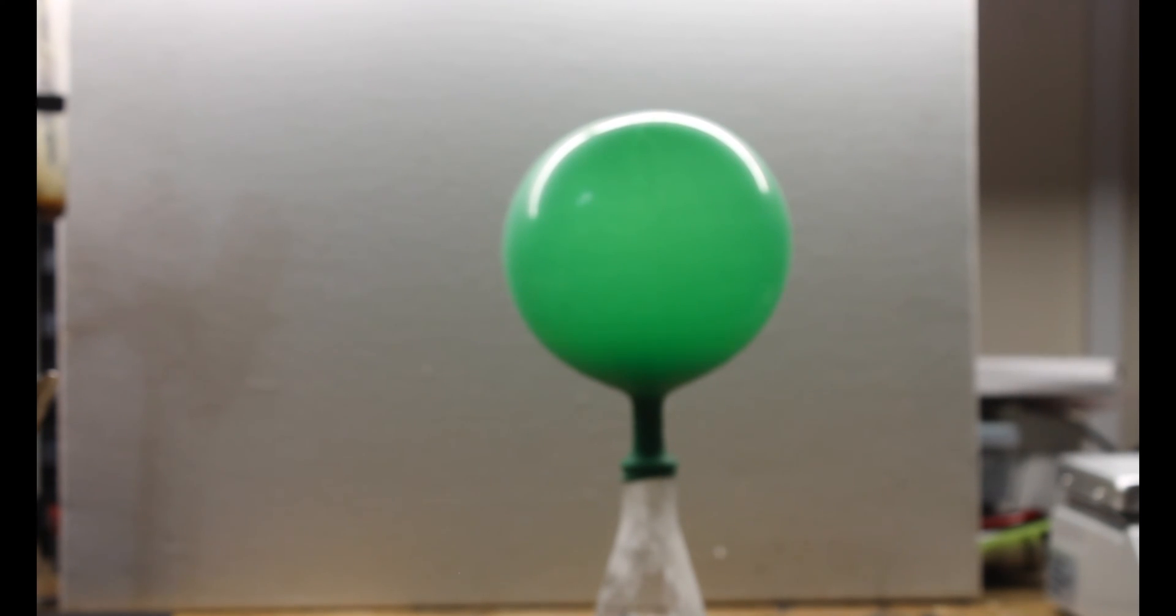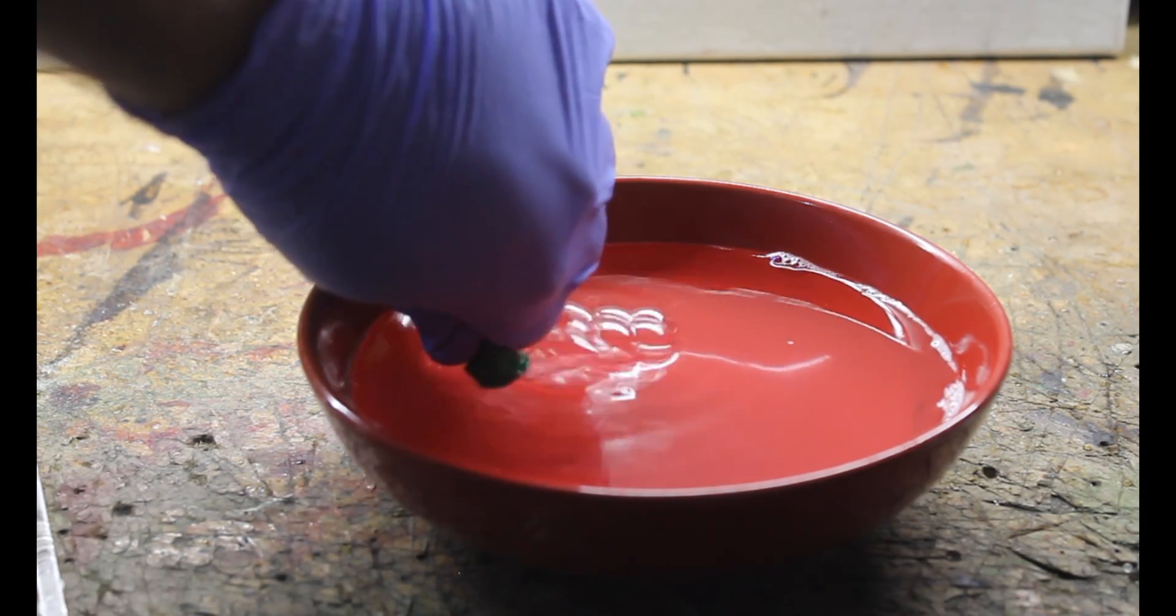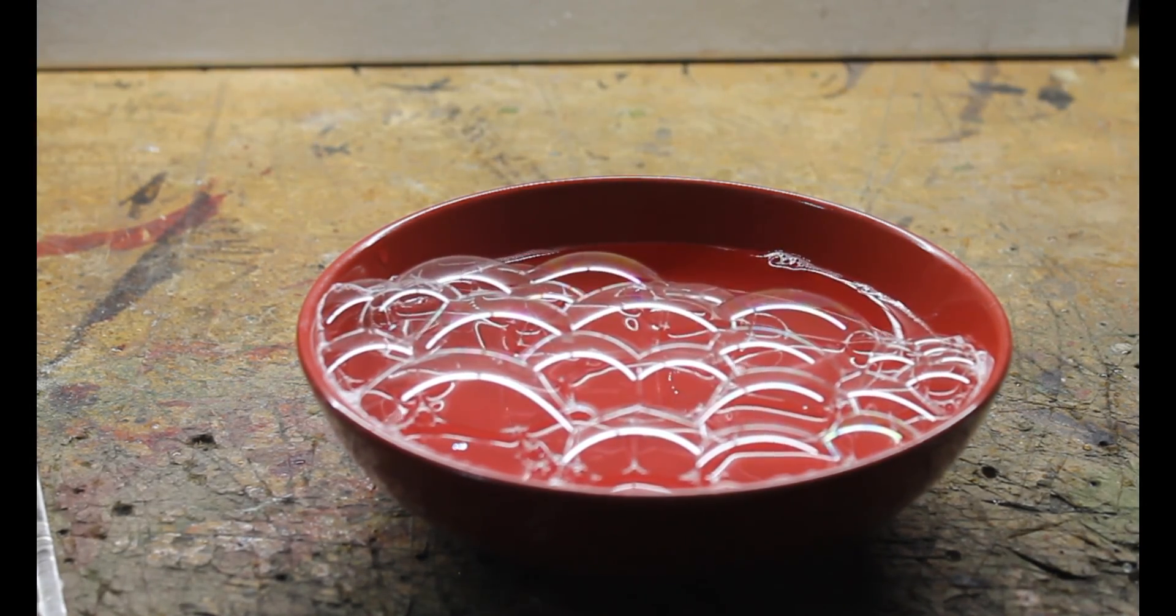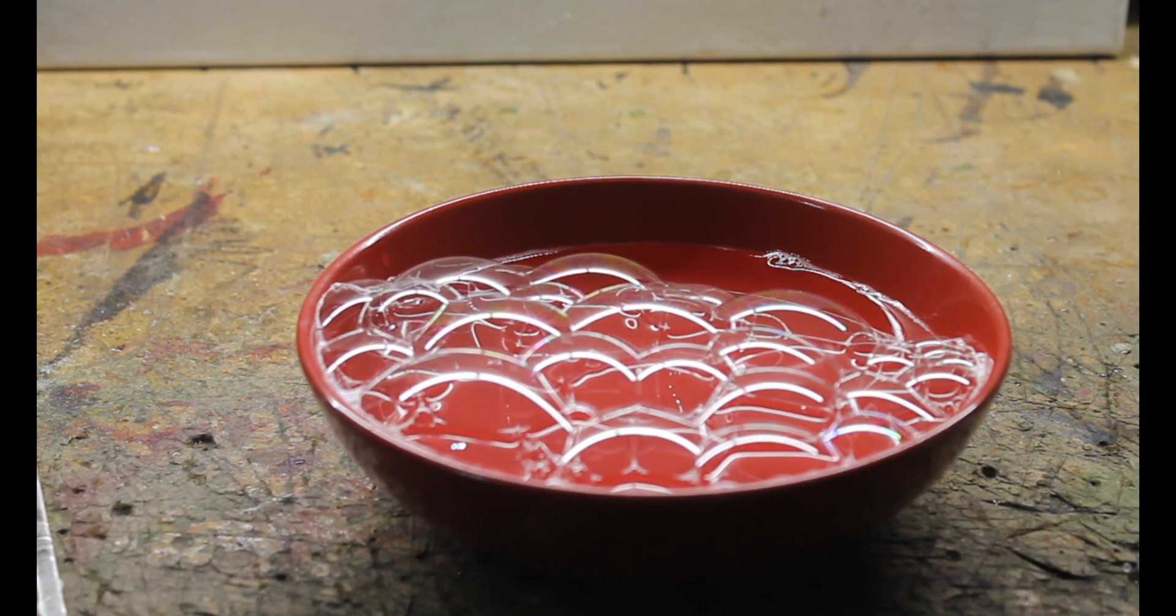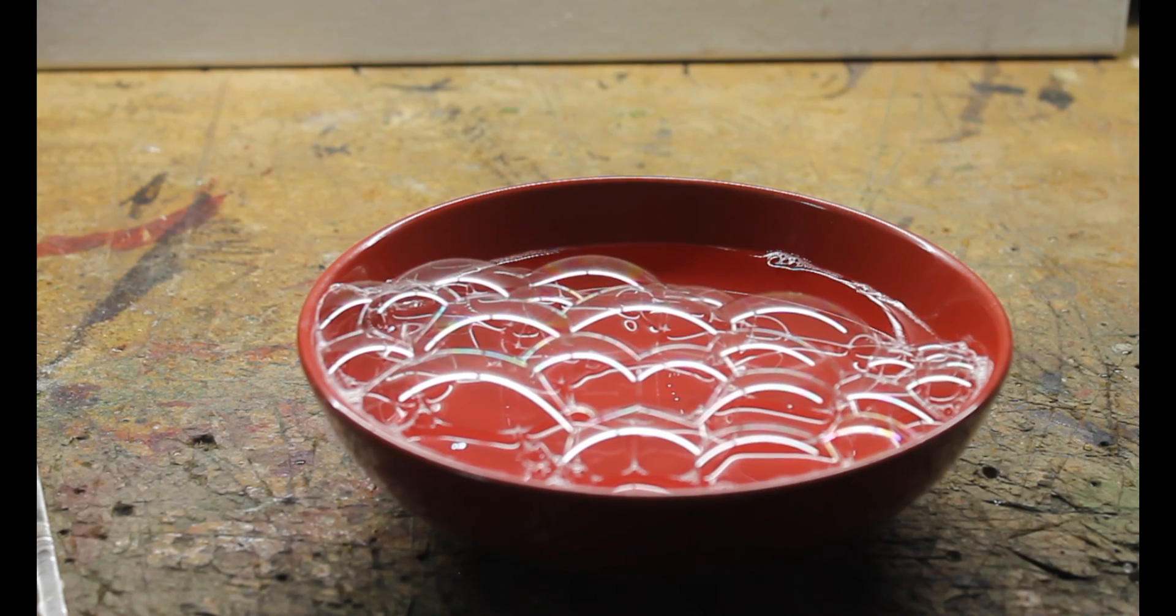This balloon was now full of explosive hydrogen gas. But instead of just taking my word for it, let's bubble it into some soap and put these bubbles in the vicinity of a naked flame.